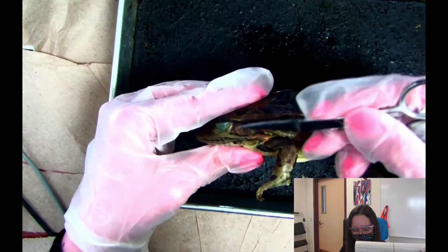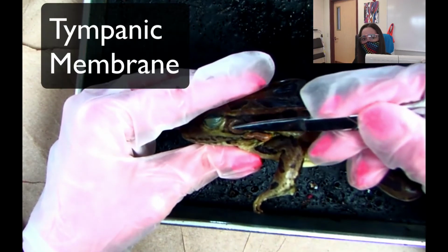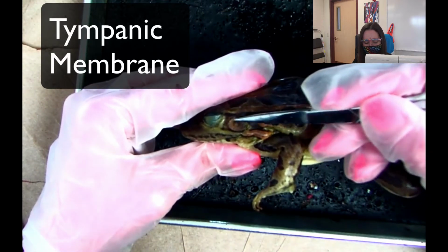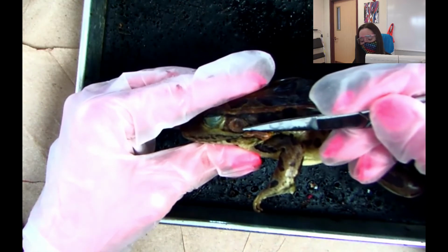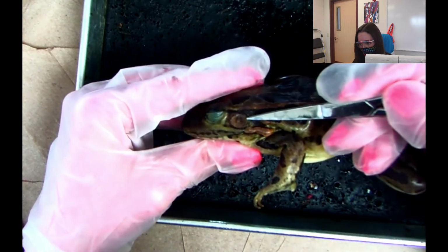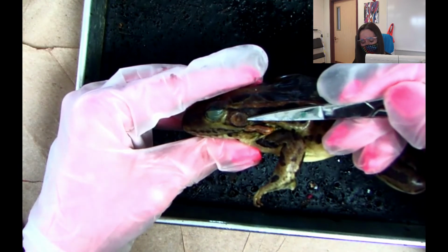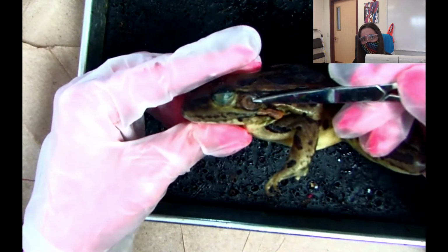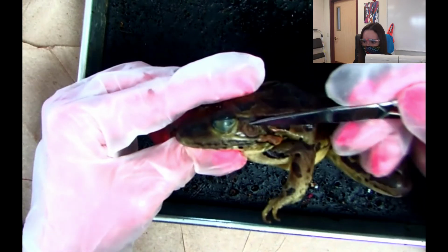We're going to start with this structure right here. This structure is called the tympanic membrane. This is basically the eardrum of the frog, and it helps the frog sense its environment. The eardrum is visible, and it's pretty easy to see. So this circular part is the tympanic membrane. If you guys are in person, you'll definitely be able to see it. Mr. Tricky and I are going to go over these parts over the document camera live for those that are remote. So that'll be really nice as well.